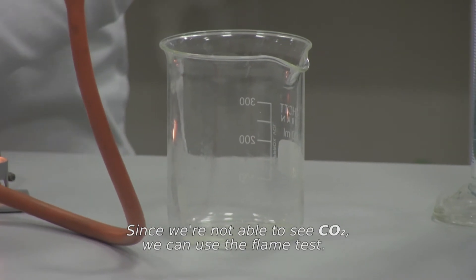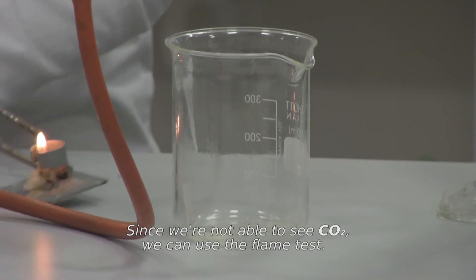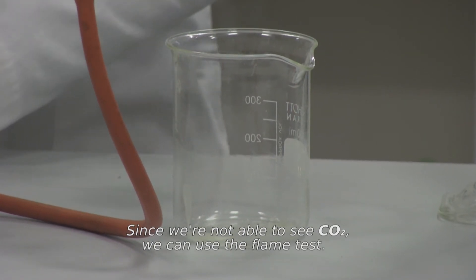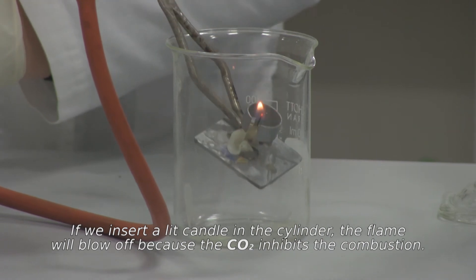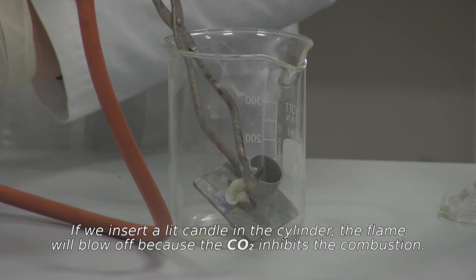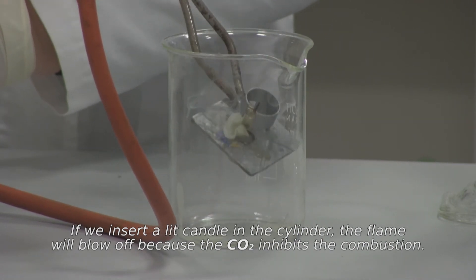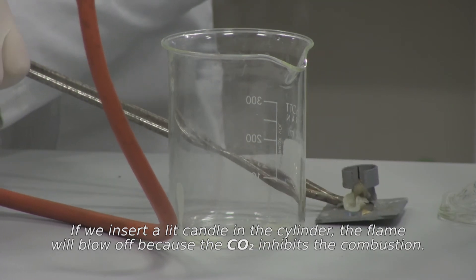Since we are not able to see carbon dioxide, we can use the flame test. If we insert a lit candle in the cylinder, the flame will blow off because the carbon dioxide inhibits the combustion.